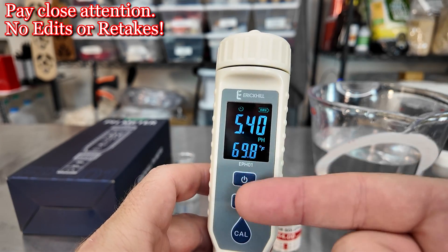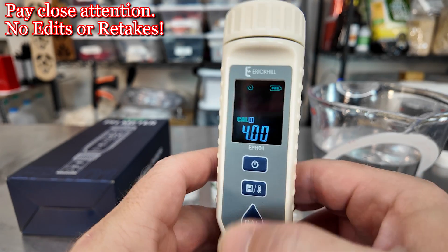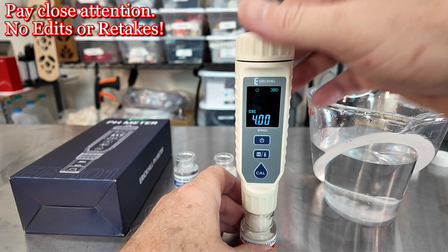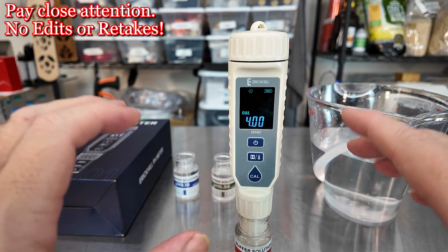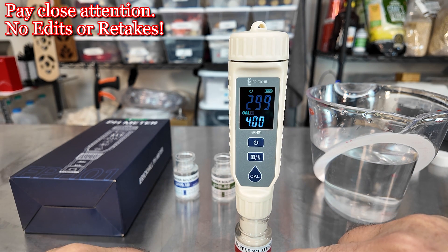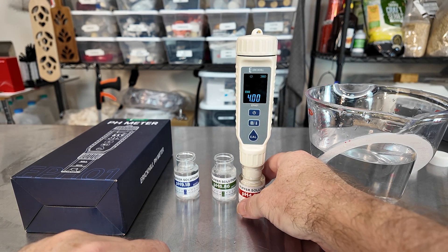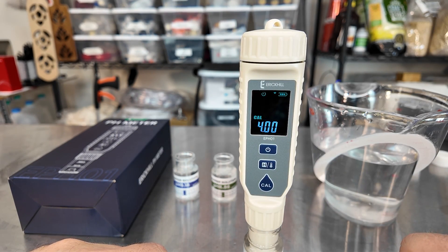We're going to do a calibration. We're sitting at 5.39 and 69.9 Fahrenheit. So what you're going to do is hold the calibration button down. Now we're going to stick it in the calibration liquid — you may spill some. Keep watching up here towards the top — you're going to be looking for some pieces of pie. The calibration liquid is of course 4.00. We have one piece of pie, we need four pieces to complete. It resets — that's fine, that happens.